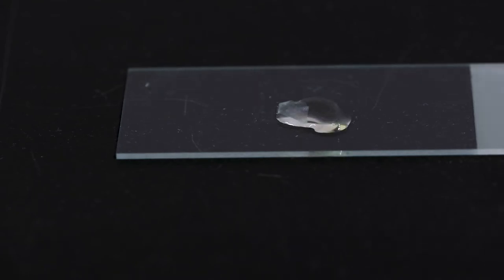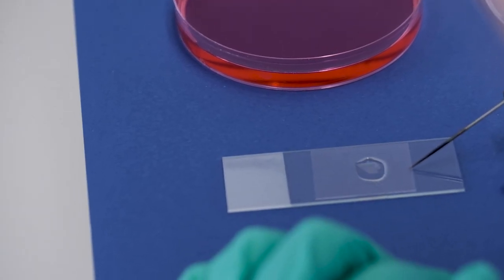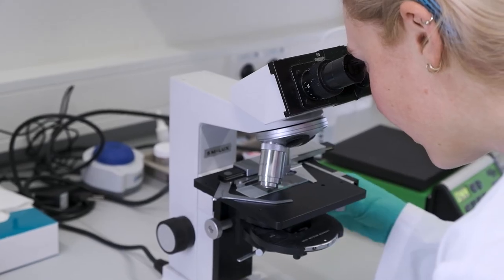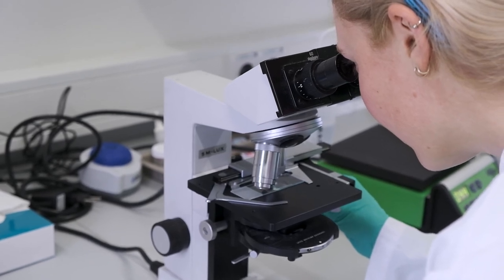And when it's finished, you take it back and you cover it with another cover glass. And you wait for it to cool down, which goes pretty fast. And then you can check it again under your microscope. It's fixated so you can't change it anymore.